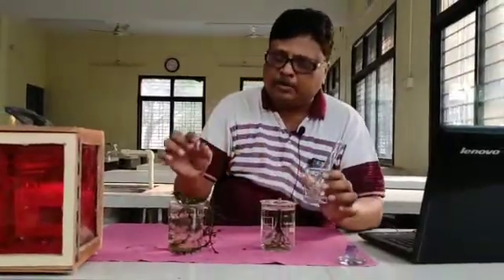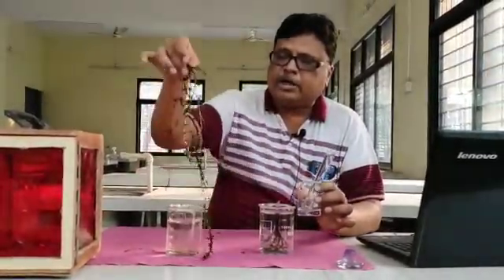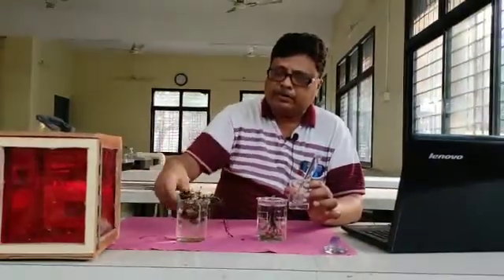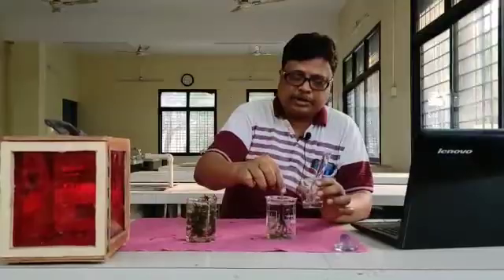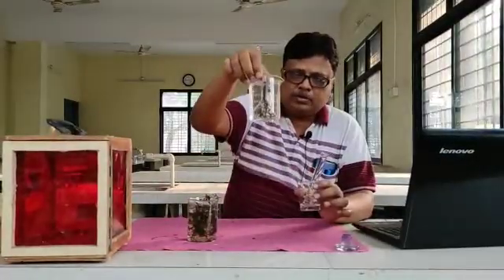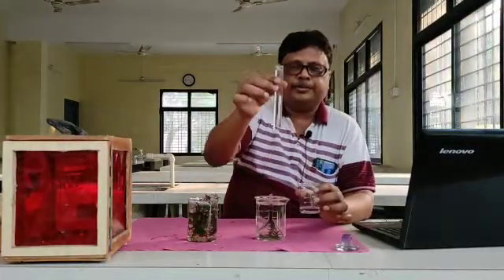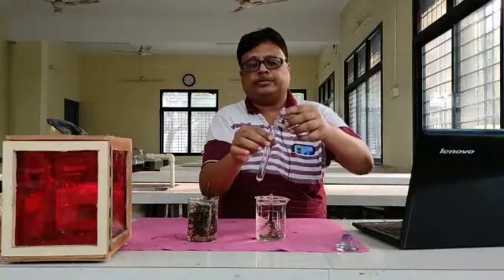So, what happened here? The hydrilla plant, which has a hydrophytic type of habitat, is a submerged one, and we have submerged it into this small beaker. Now take one test tube.